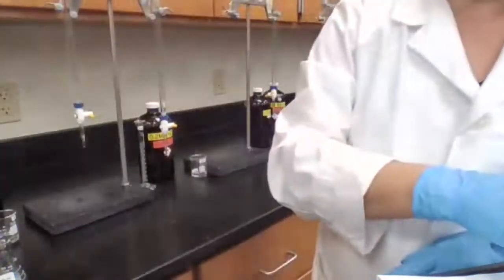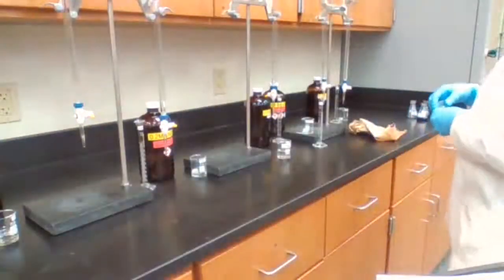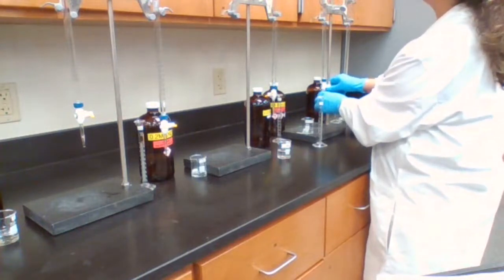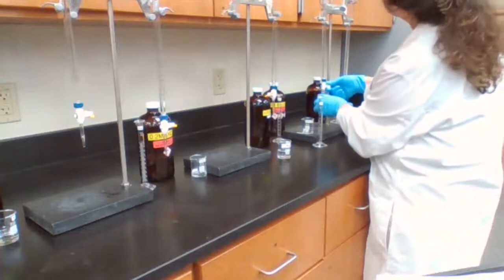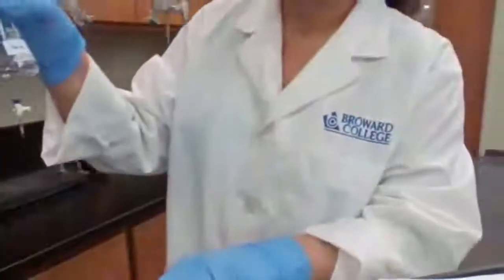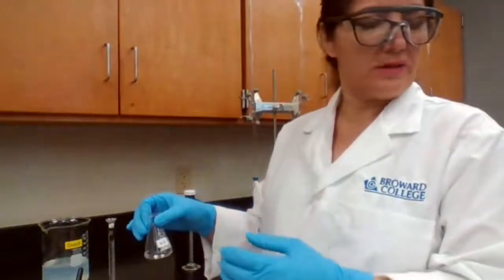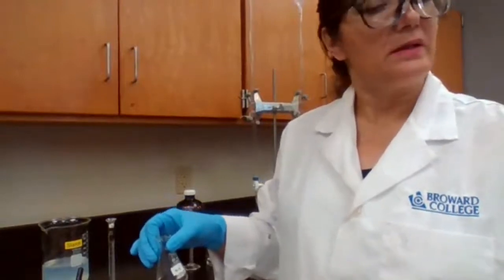And I need to make the B4, 8 milliliters of S2O8 only. 8 milliliters of S2O8, going from 22 to 30. I have 8 milliliters in flask B, 11 milliliters in flask A. When I'm mixing together, the final volume is going to be 19 milliliters. That's why you calculate concentration in the final mixture based on 19 milliliters.